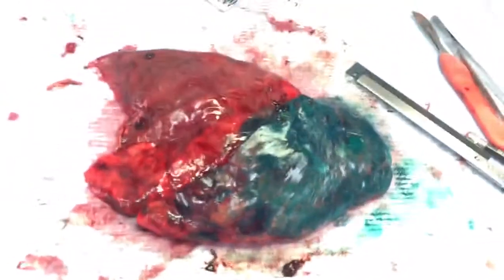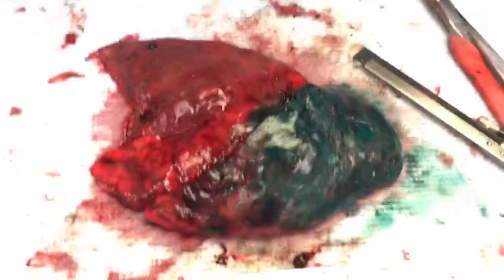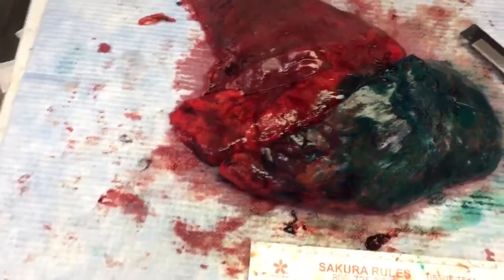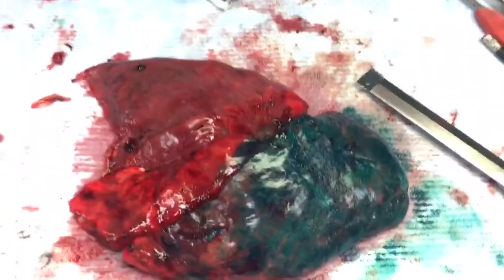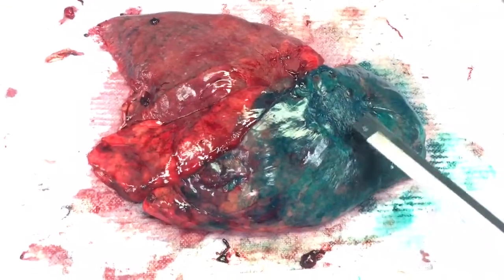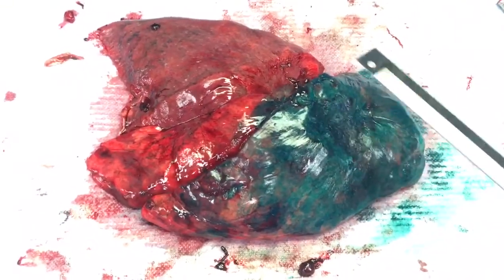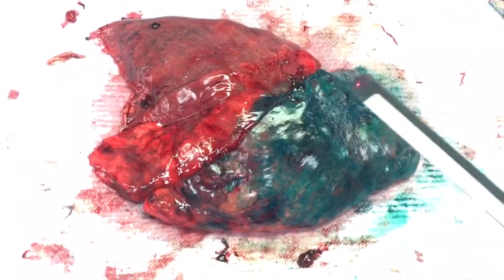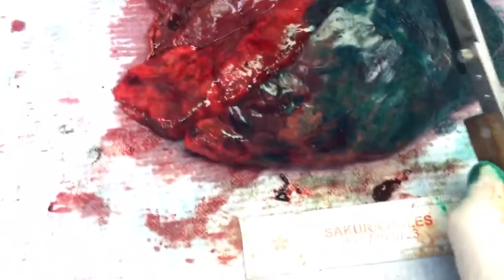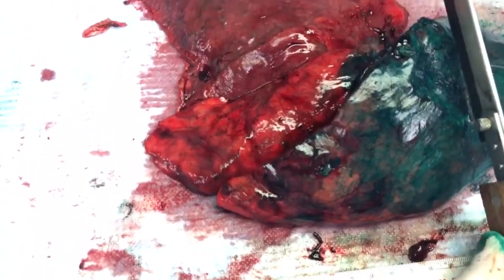This patient has a 50-pack year history of smoking. I don't know what that means exactly, I just know it's a lot of smoking. What I'm about to do is cut into this and show you something big. It should be about a 6-centimeter mass, so I'm going to go ahead and make this cut right here.